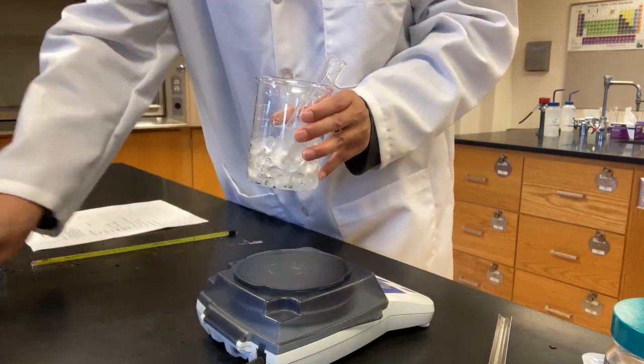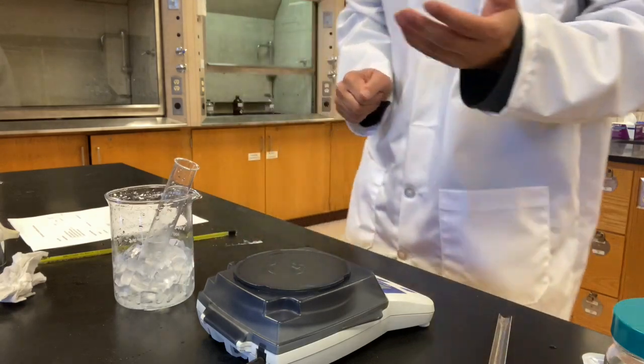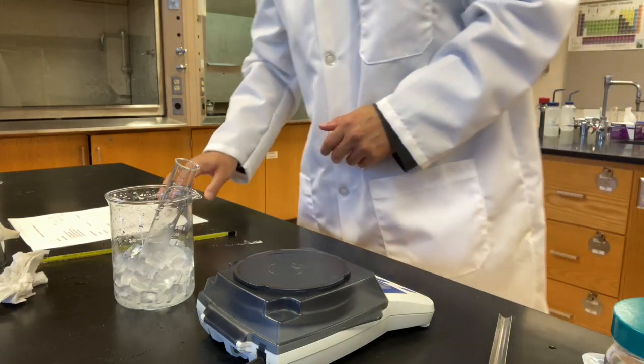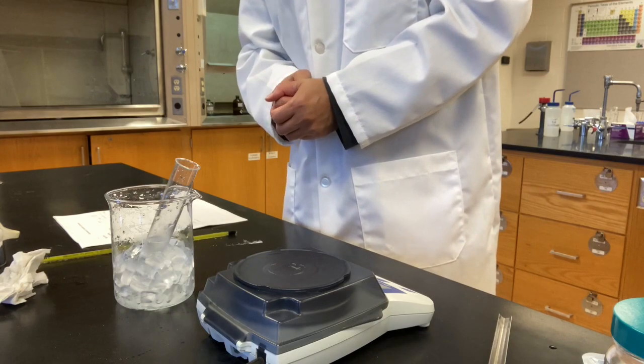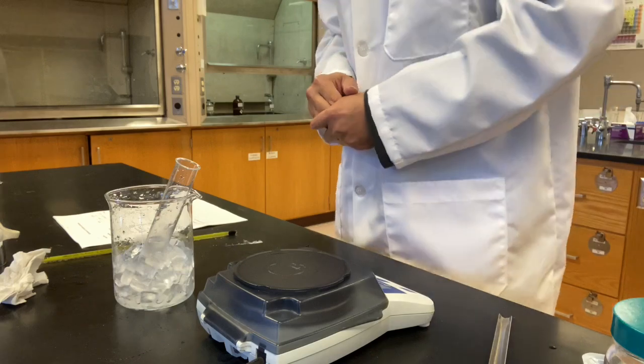So lots of solid coming out. Okay, you write it down again, explain it. We actually kind of explained it already. So take a record on line 5, write down what you observed when you put it into an ice bath, and put your explanation under that section.